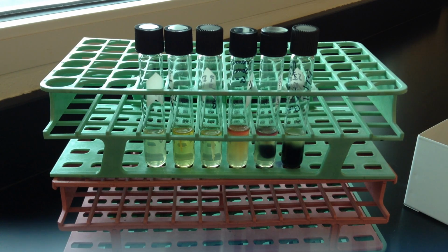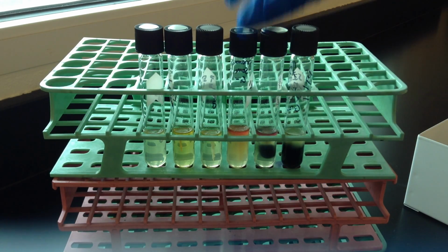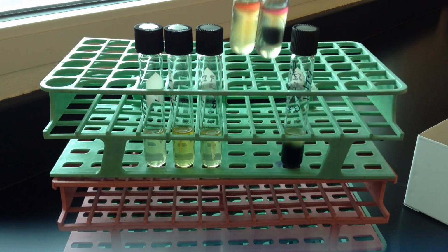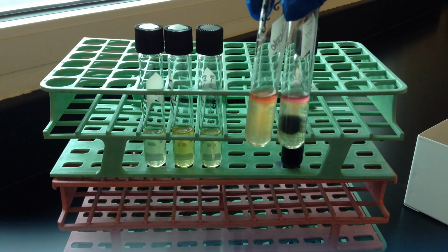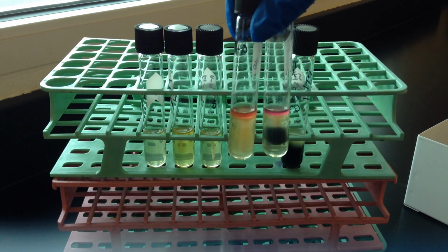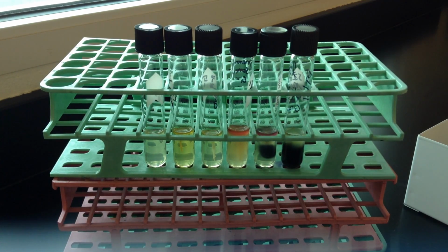Indole is associated with motility, because we know that it can be used as a signaling molecule, which helps in the formation of biofilms and things like that. So indole is commonly associated with pathogens. And again, you have to use the Kovacs reagent to truly test for it. So of the group that I have here, I have a little bit stronger red ring. Sometimes the red ring can be pretty light, but you're looking for the formation of the red ring at the top after you add Kovacs. So if you don't add Kovacs, you'll have no idea. And so this again would indicate that just these two organisms out of the set have the enzyme tryptophanase.